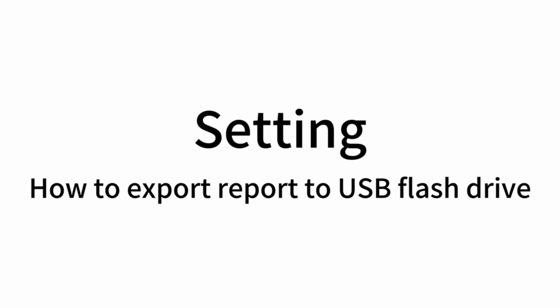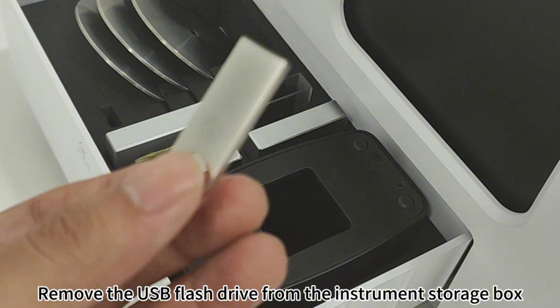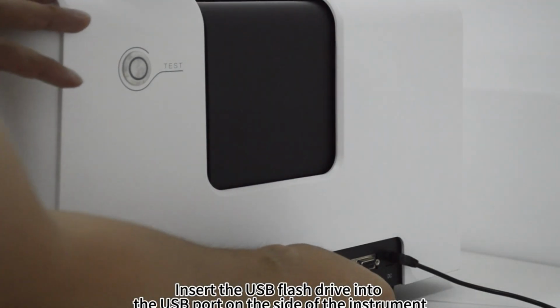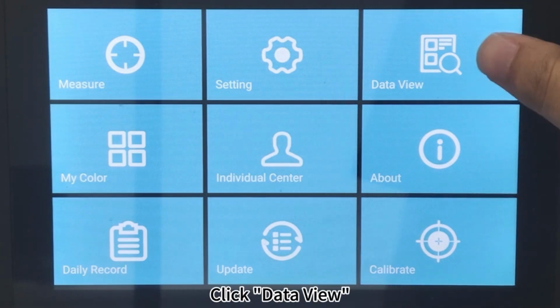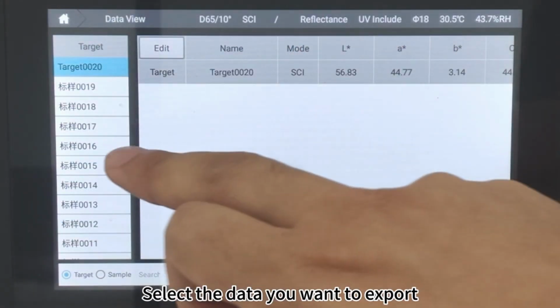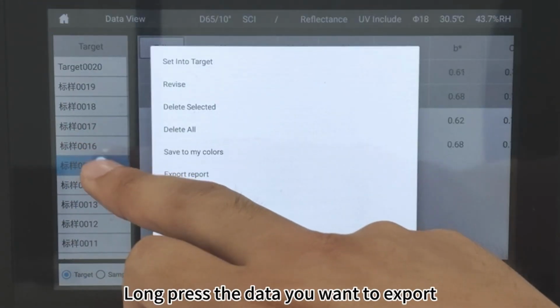Setting. How to export report to USB flash drive. Remove the USB flash drive from the instrument storage box. Insert the USB flash drive into the USB port on the side of the instrument. Click Data View. Select the data you want to export. Long press the data you want to export.